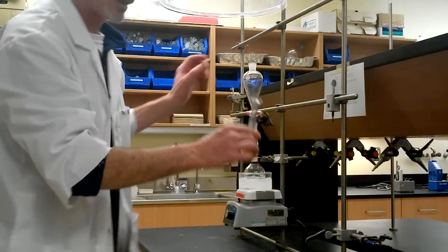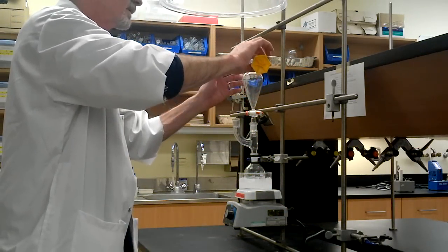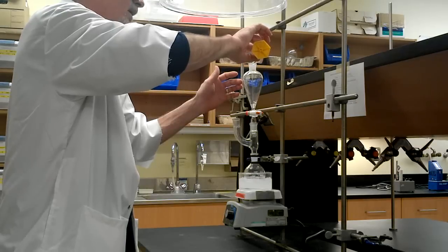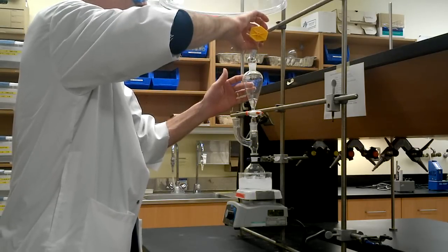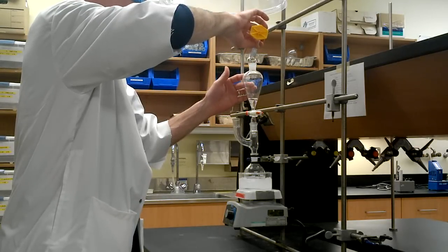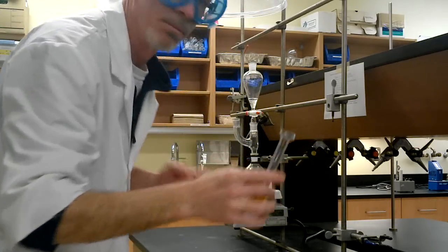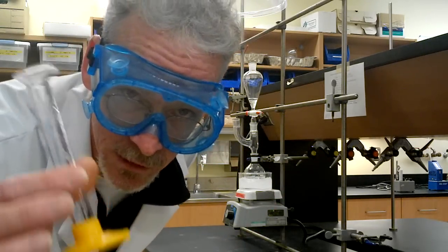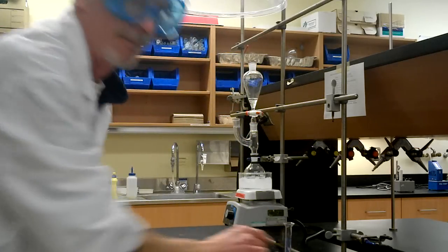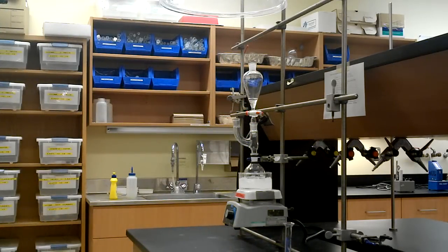Now, the sulfuric acid goes up here. Oh, I just spilled some acid. Please wash this immediately. Okay, that's all cleaned up.